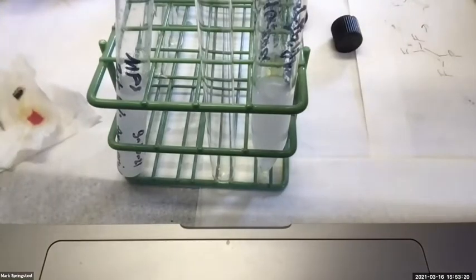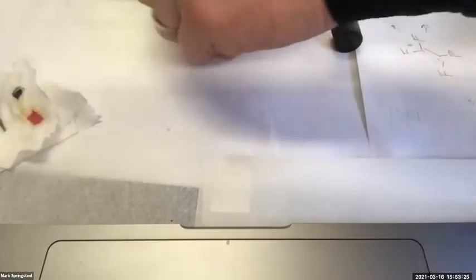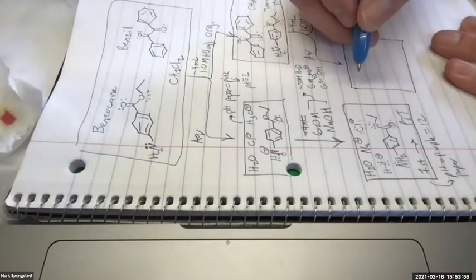Looking good. Okay, so we did have excess amine in the organic layer after the first extraction, huh? So let me show you what I mean. So we definitely had some amine here, huh? Can you guys see what I'm drawing okay? Yes. Yep. And then what do we get in the aqueous layer here? Mostly benzocaine. Or H2O, sorry. Mostly H2O, good.